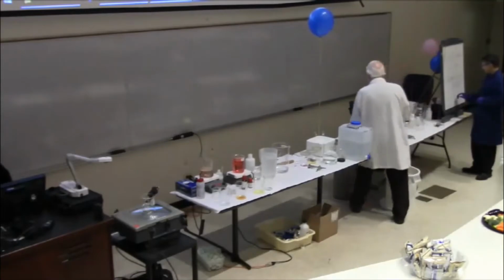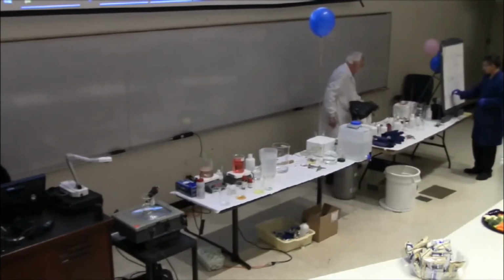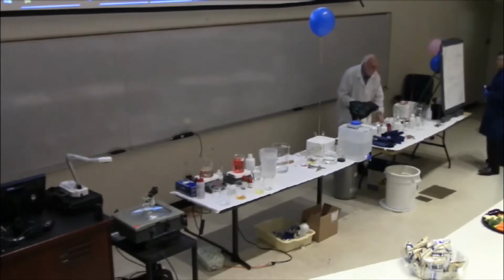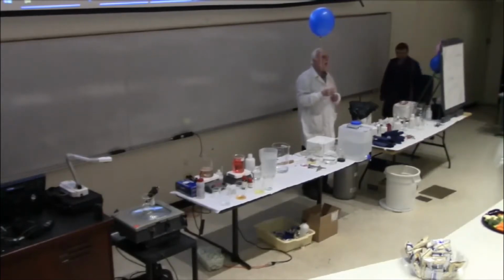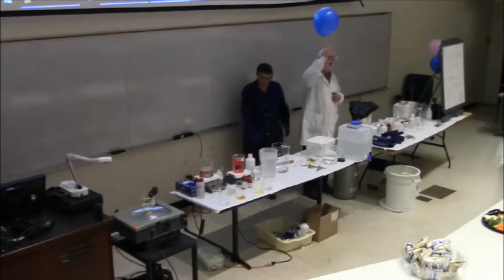Now let's take another common material, sand, SiO2. We'll put some of that in another test tube. Now this is after purification, white. Sand, you get some other impurities. Formula for sand is SiO2. Who knows the properties of sand? We can say that it should be white and it's a solid.